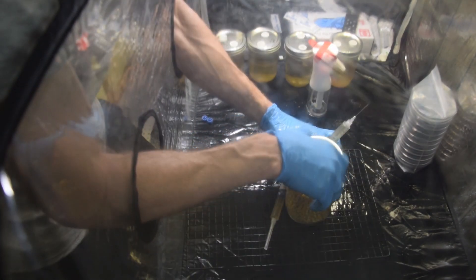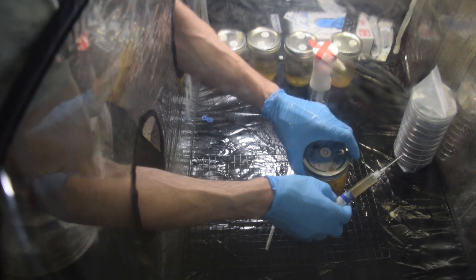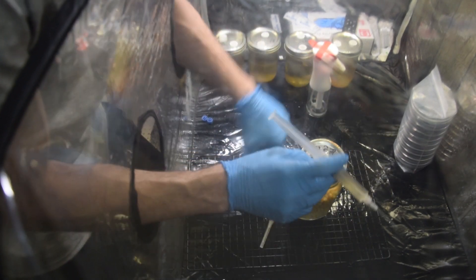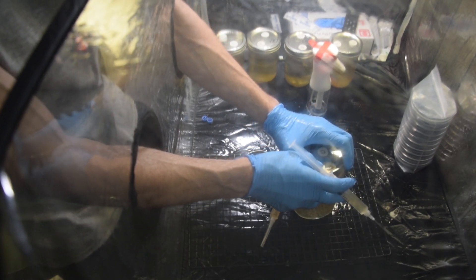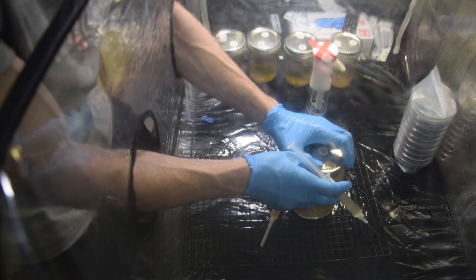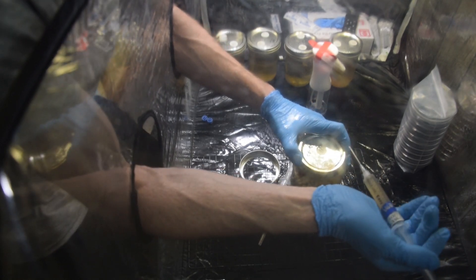We got this one done. Typically when I'm not talking, I have an assembly line set up. Oh my God, you guys — I didn't even — oh, it's not done! What the fudge, I'm talking too much. All right, let's inoculate this jar real quick. I would have been waiting and waiting for weeks — I'd be like, that's one slow-growing liquid culture. Sorry for the language. Let's inject this.